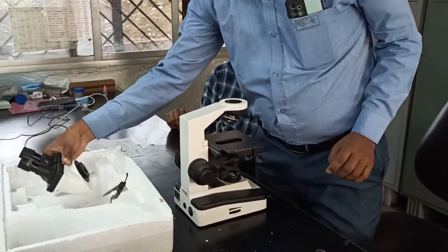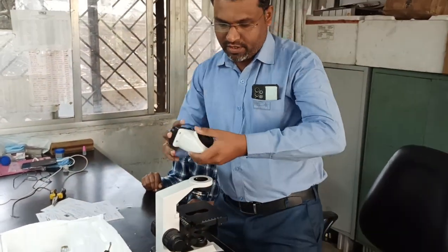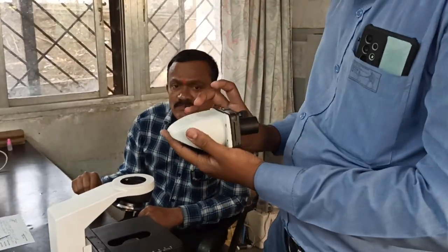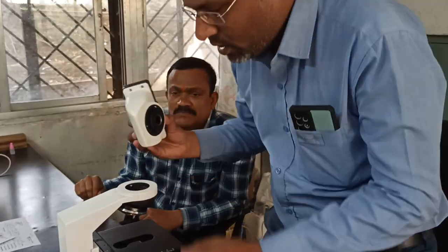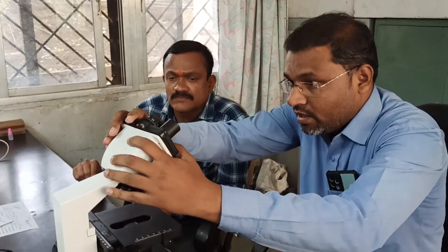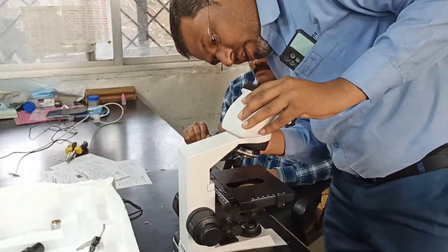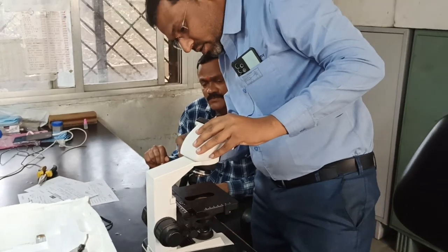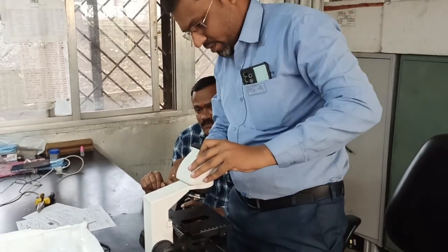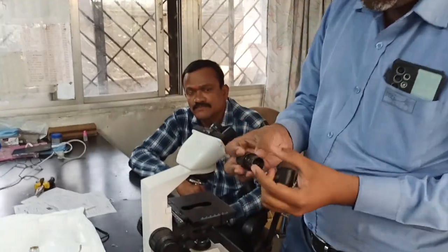Next one, this is your main head here, right? So how to install the main head? You can observe, this is a slot which is given, right? So how to fix it, just put it like this. It has one bigger Allen key provided with it. With the help of this you can tighten it so it will not fall down, right?